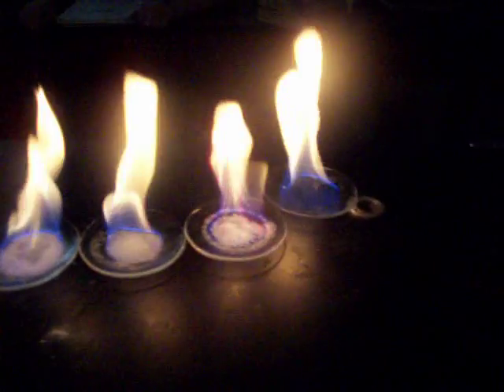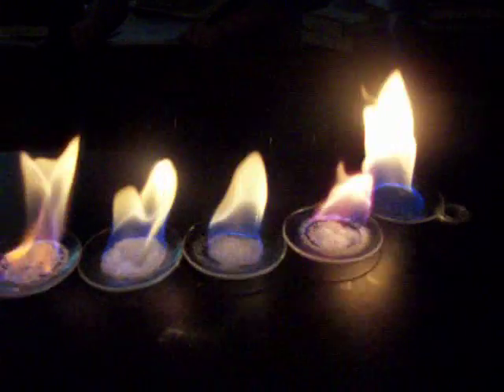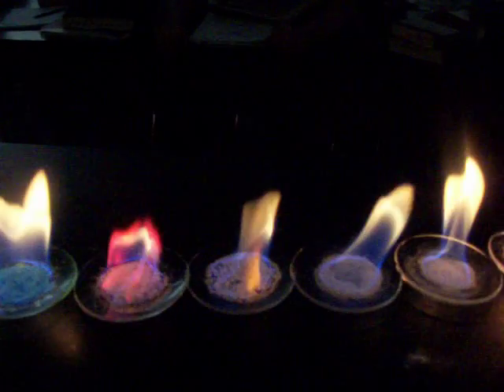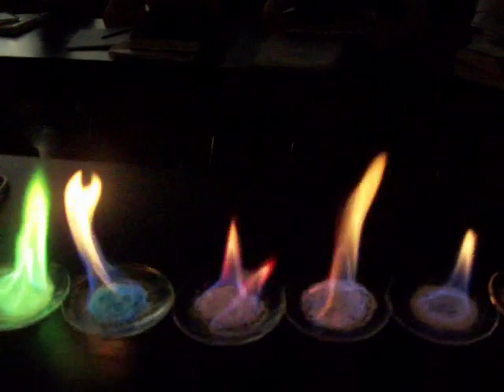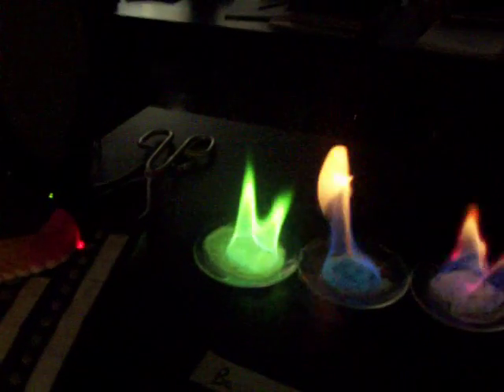Comparing these to one another, you'll note the blue and yellow flame of the alcohol, the pinkish flame of the lithium, and the yellow flame of the sodium — not too different from the alcohol flame. There's a very faint lilac flame; I'm not actually seeing any of the lilac color coming off of the potassium salt yet. Then there is the calcium flame with the orange color, the strontium flame with its darker red. Compare the dark red of the strontium to the pink of the lithium. The green of the copper and the lighter green of the boron.